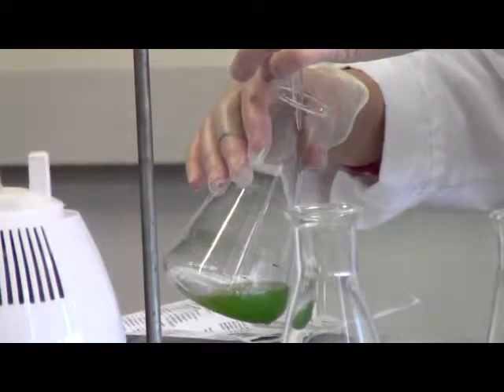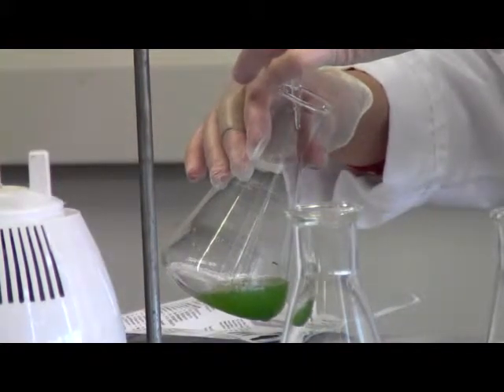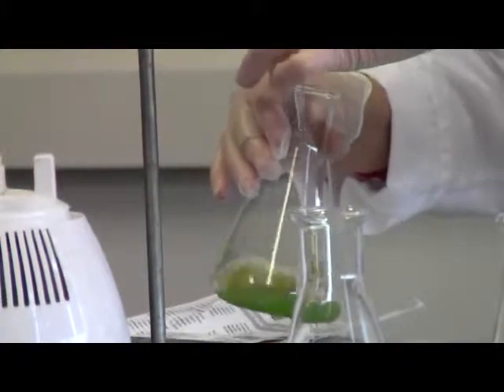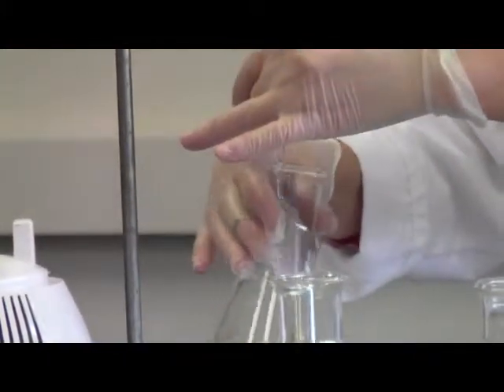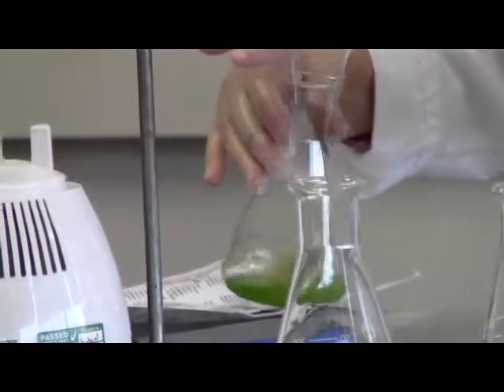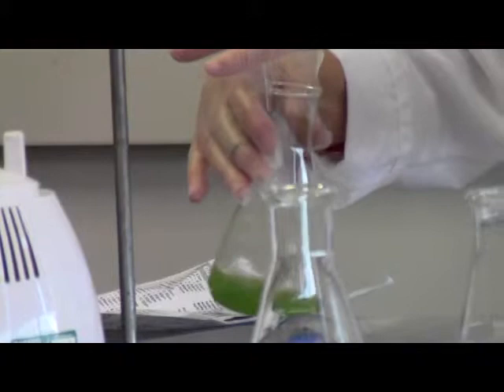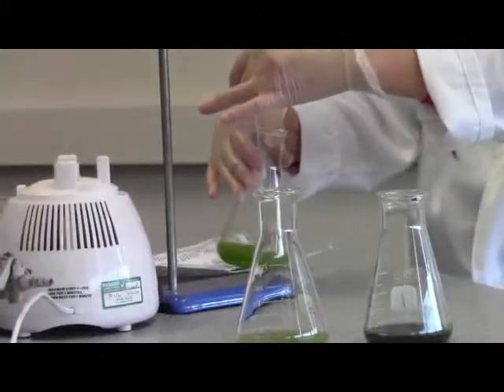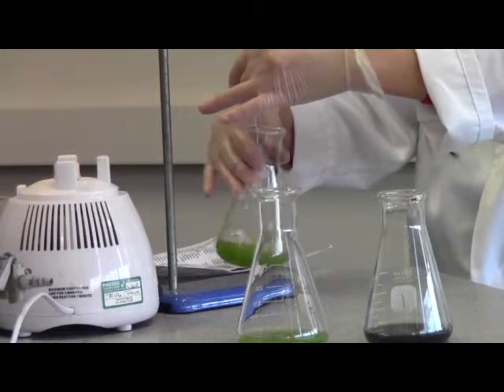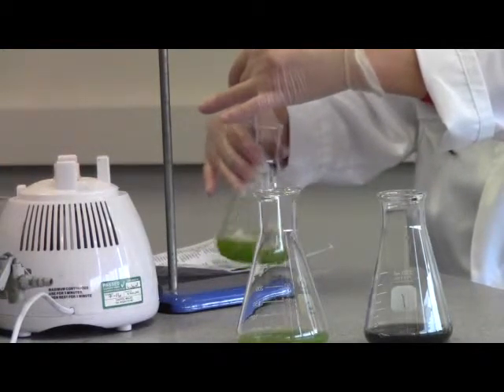Now you know roughly about 1 milliliter can be quickly put in. Normally 20 drops is about 1 milliliter, depending on the size of the titrant tube.